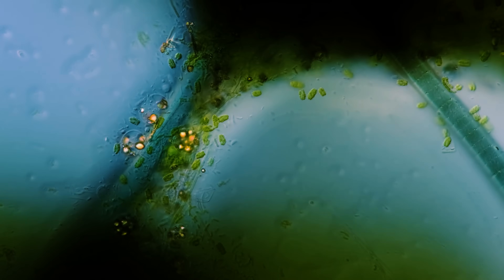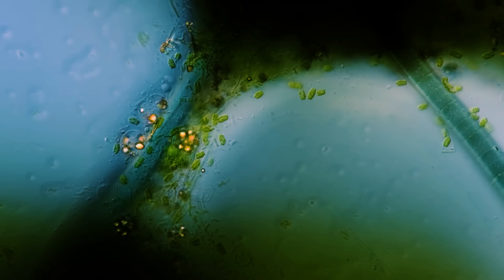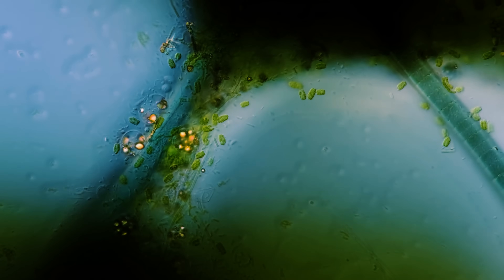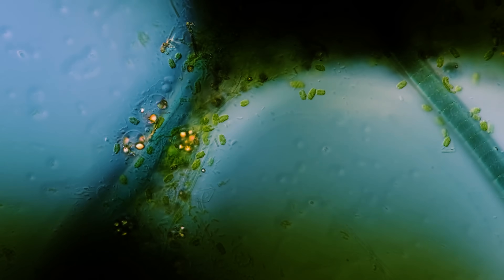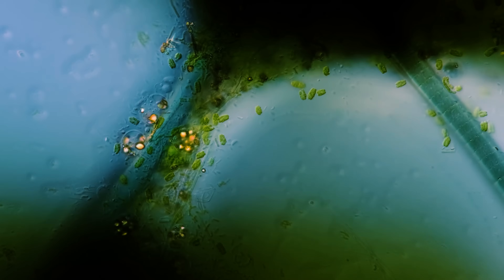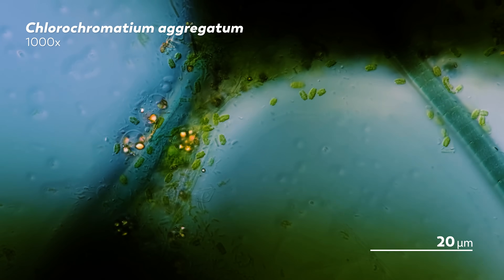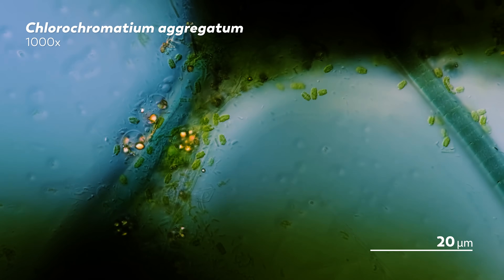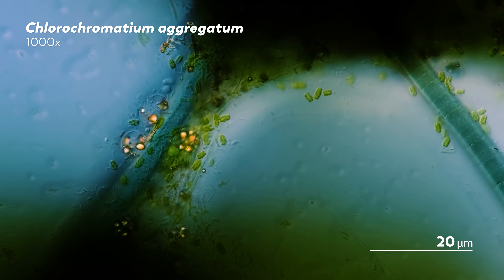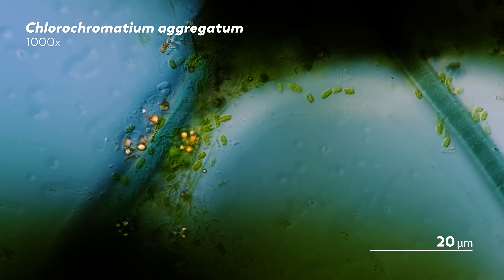If you have been venturing through the microcosmos for some time now, these oval green shapes likely seem familiar to you. They are not particularly distinctive, but they are green and big enough to see under the microscope.